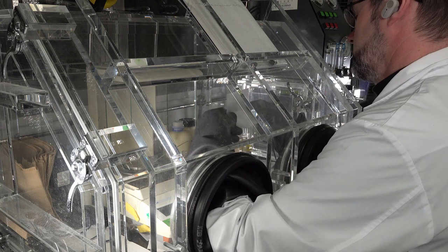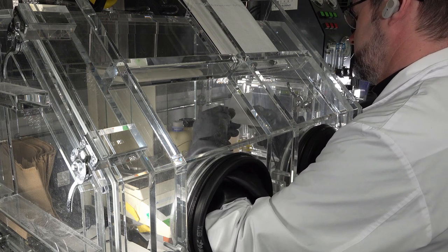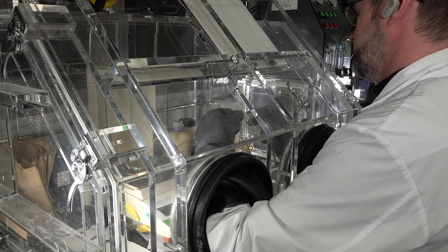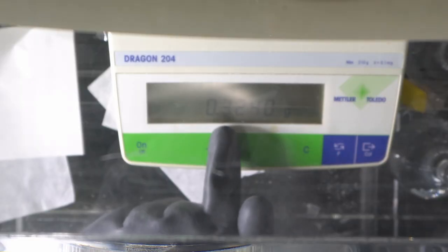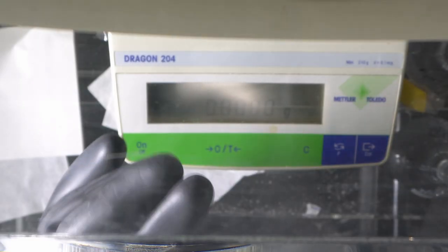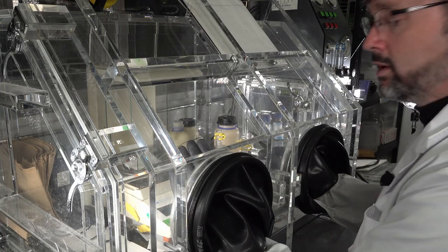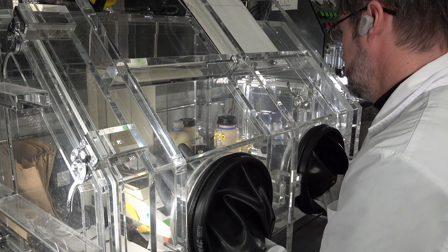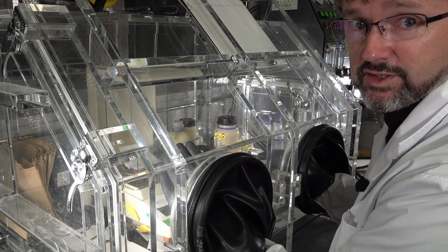Let's zero that. Okay, alright. So when I'm making up these solutions, I like to start with one of the easiest ones, which is just a dilution. This is formaldehyde solution and I just need to dilute this down. Really easy.